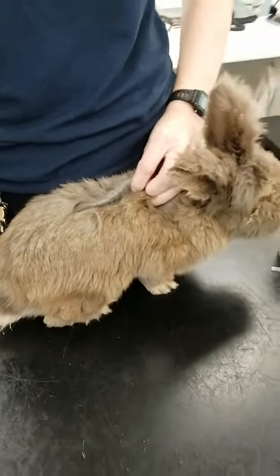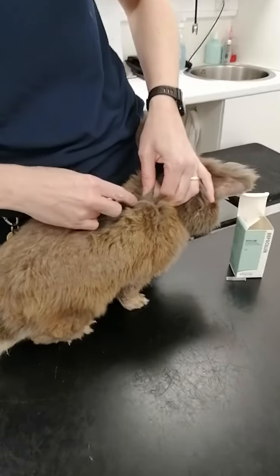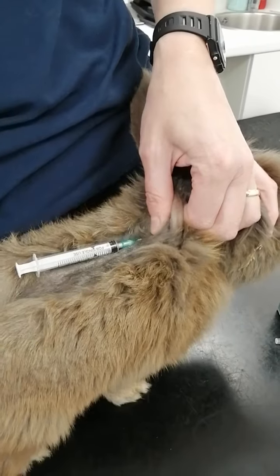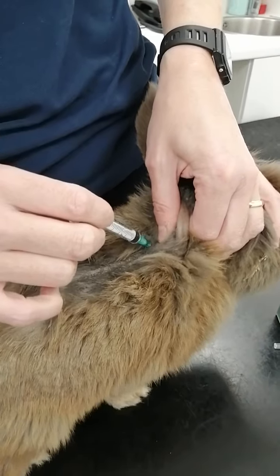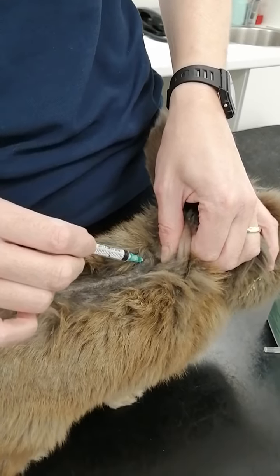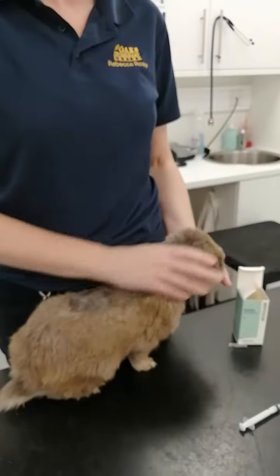I'm going to show you that again with an empty syringe. Just pull up the skin at the base and then push the needle through. I'm generally putting it in at 45 degrees and, as you can see, it doesn't hurt him to do that — and then you can inject under the skin. There we go, and that's done.